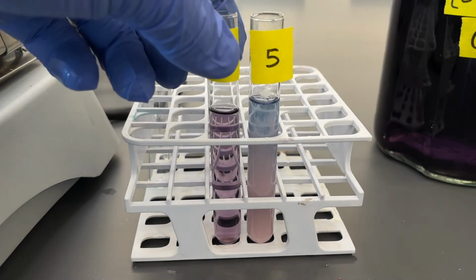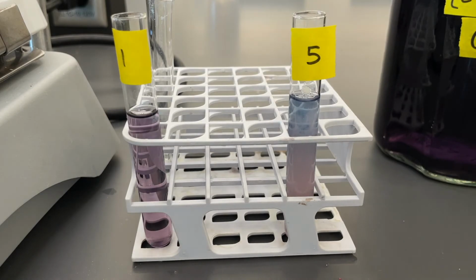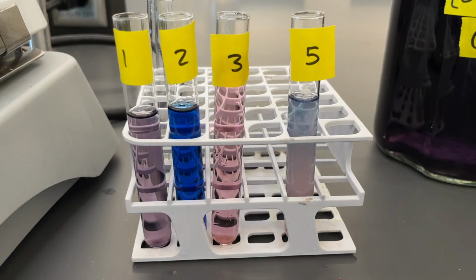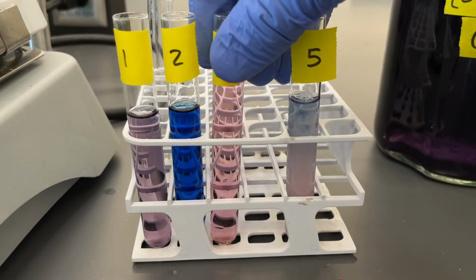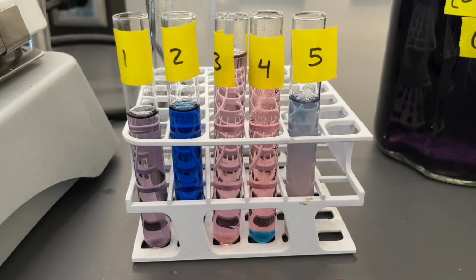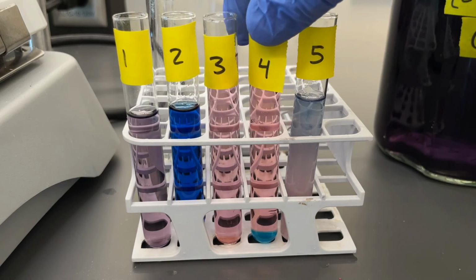So here we got test tube 1, that's our reference. It's test tube 2. This one I just heated it back up. We got test tube 3, where we added hydrochloric acid and water to bounce it back and forth. And then number 4, where we had added our calcium chloride, making observations, see how they're different, how they're the same, and why they're different.